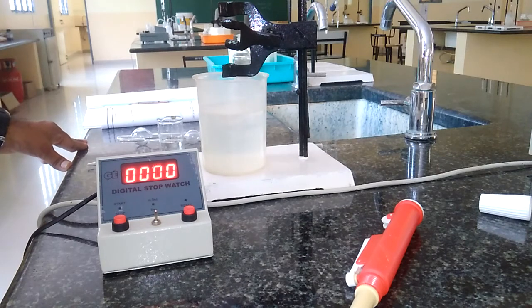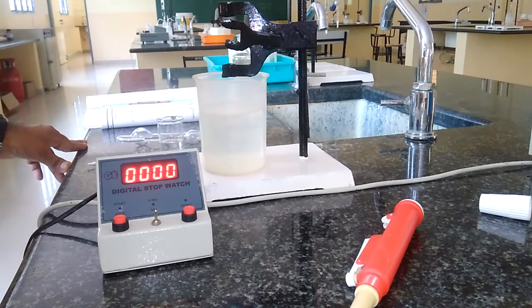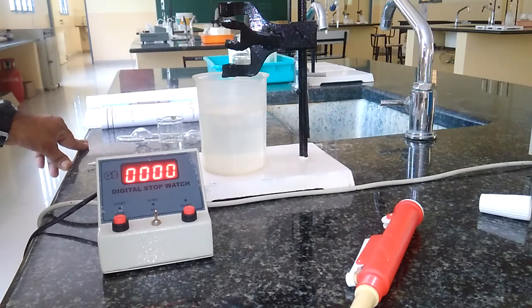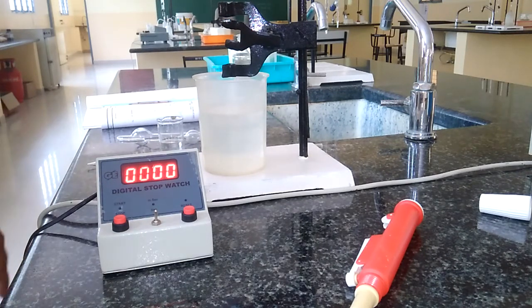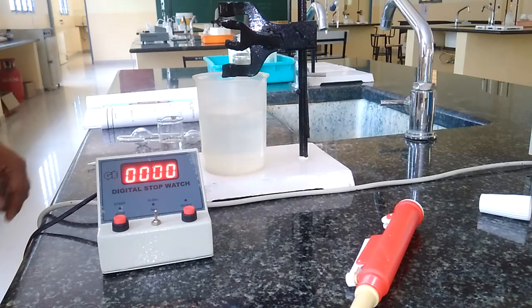Today I am going to give you a demonstration of determination of viscosity coefficient of organic liquid using Ostwald viscometer. For this experiment, some components are required.